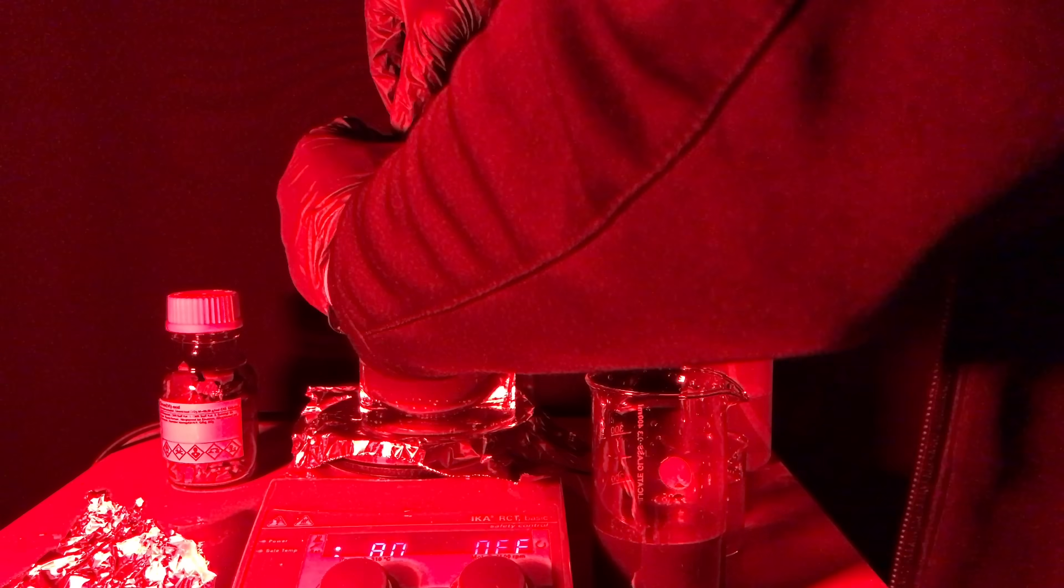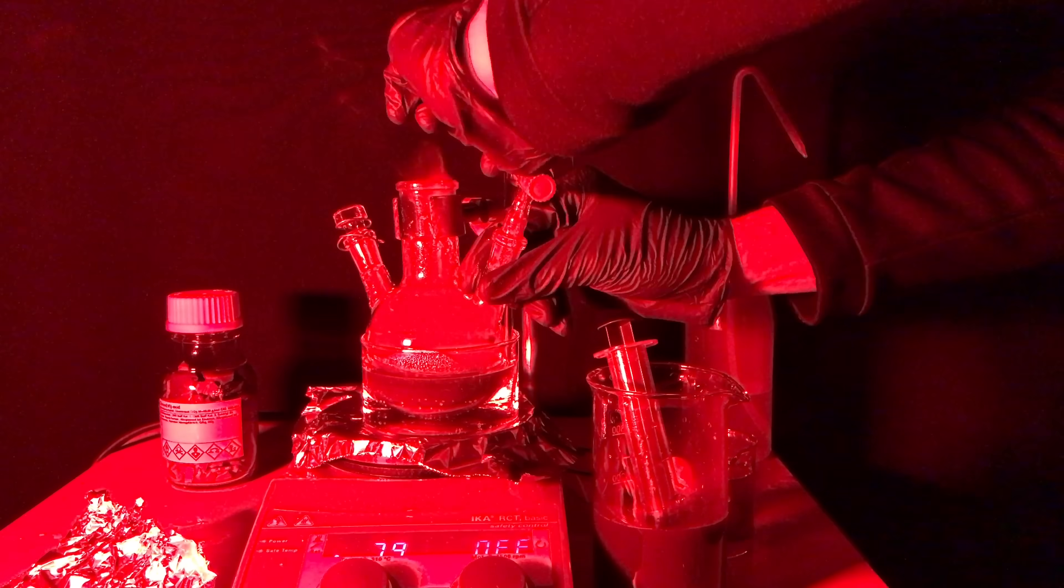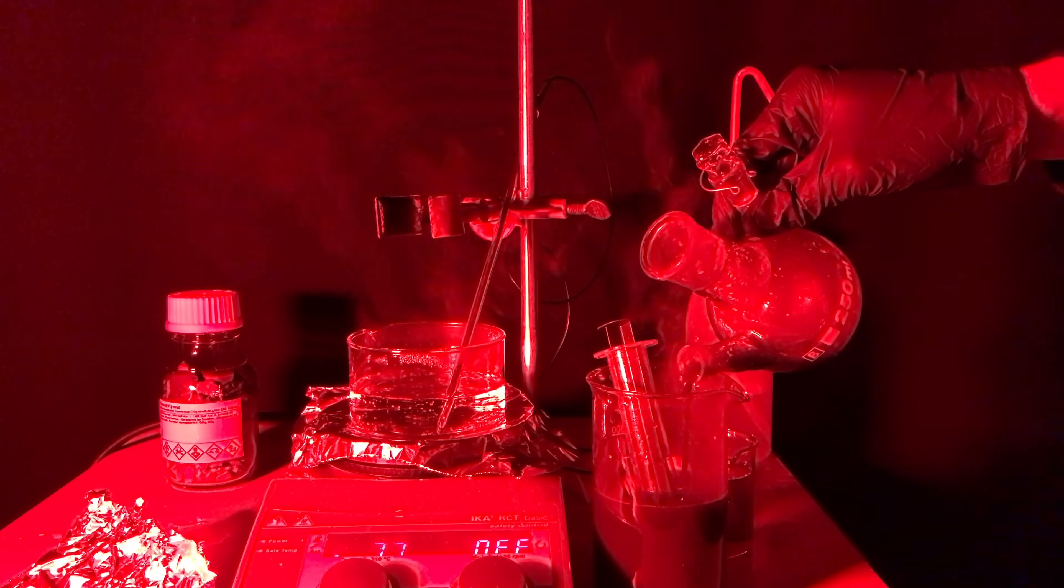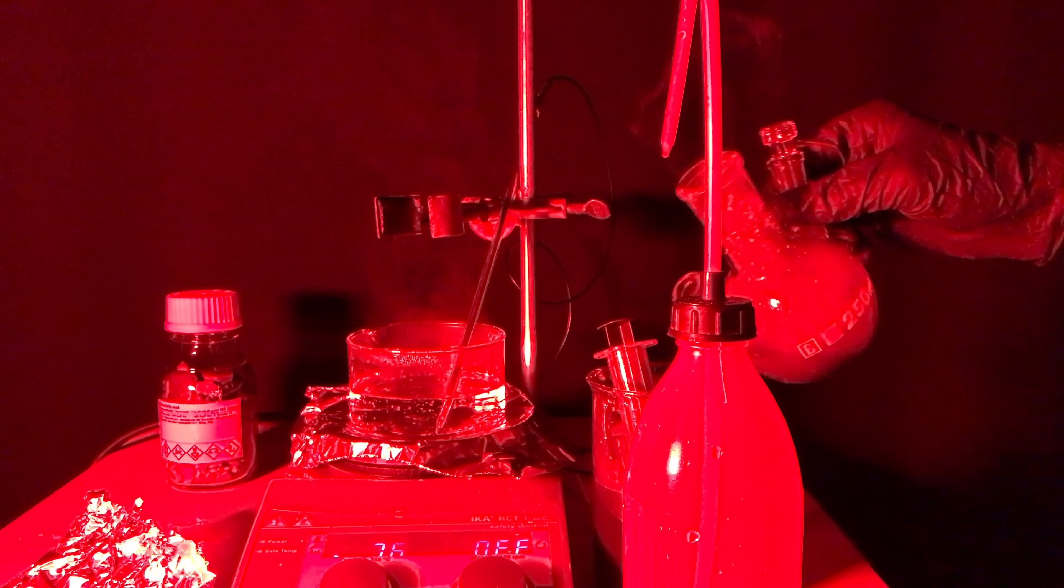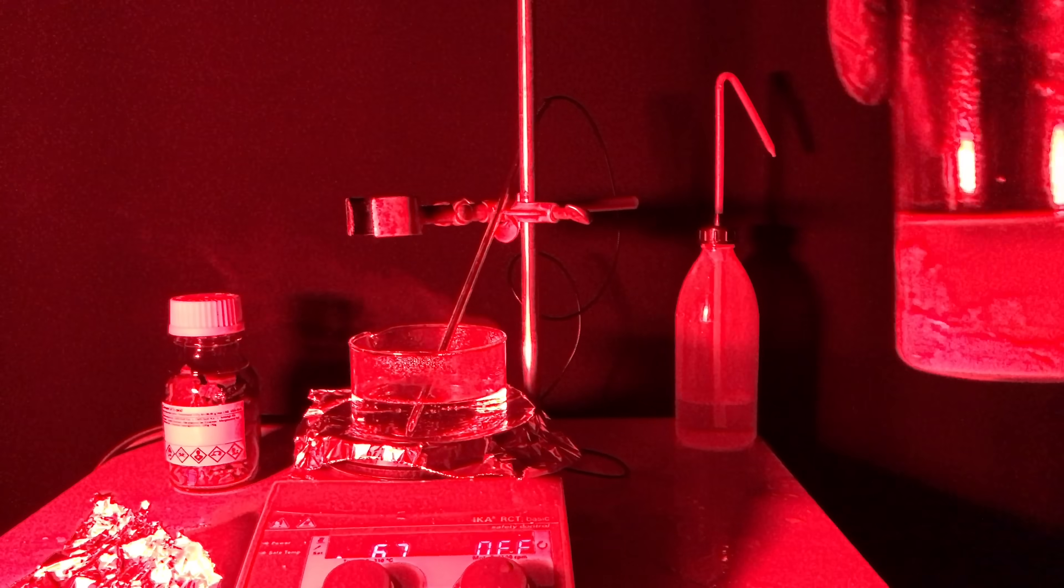While molten, the white phosphorus was transferred to another beaker containing distilled water. Keep in mind that the syringe might ignite at any moment, splattering molten fire onto my hand. The contaminated water from the beaker was disposed of appropriately and the white phosphorus was washed multiple times using distilled water.